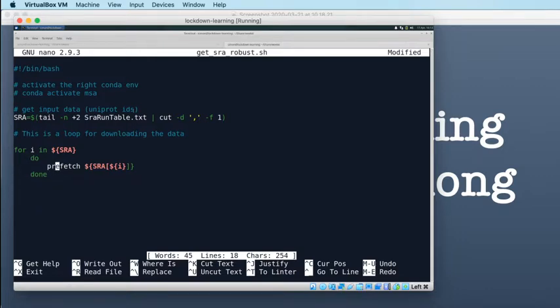Delete that as well. And this is $i. So that will download the data. And then obviously the other thing that we want to do is create the FastQ from that downloaded SRA file. So that's the other thing that we want to do in this script.